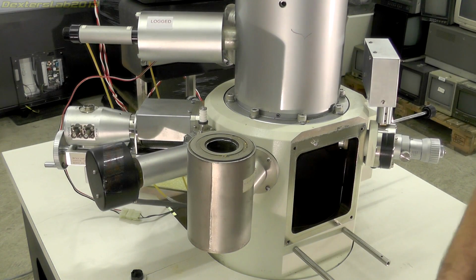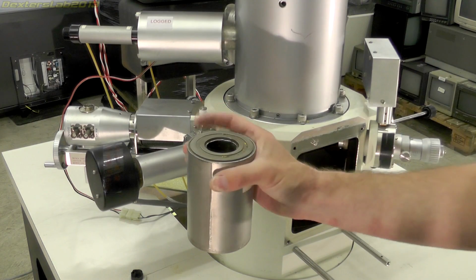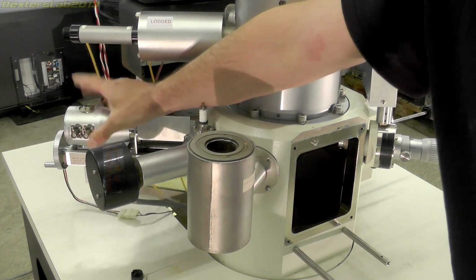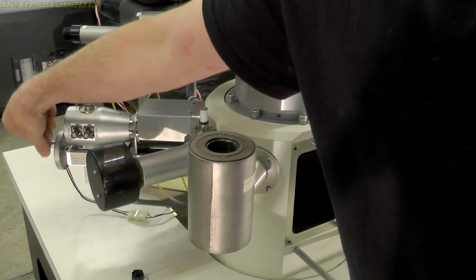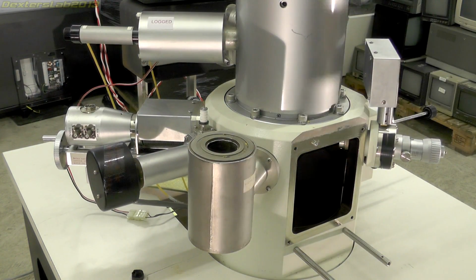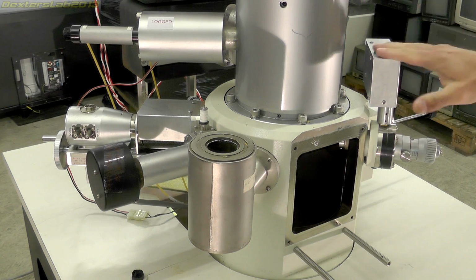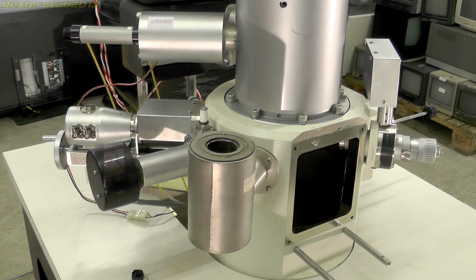So just to give you a slightly better view of those items I've just shown you, we have the liquid nitrogen dewar. This is the X-ray detector. This is the secondary electron detector. And we have that adjustment on the end there to adjust its position. This is the beam control knob with its adjustment. There is also some kind of electronic box on top of that. I'm not sure what that's for. Maybe we'll find out later.